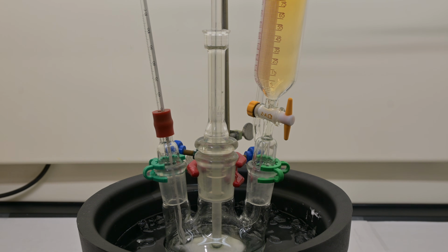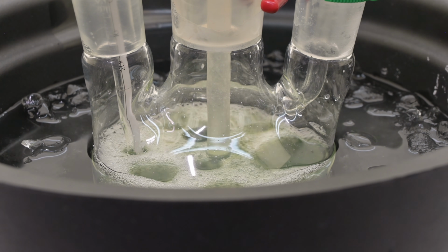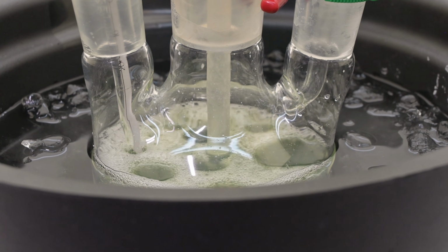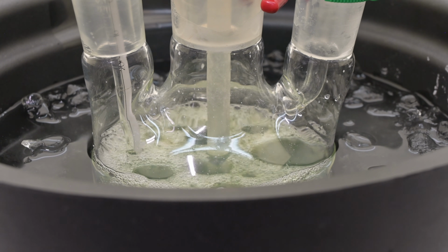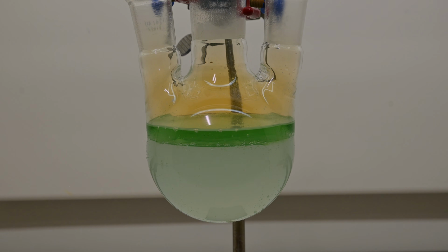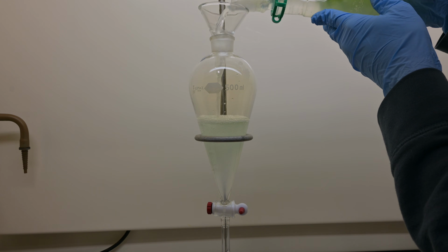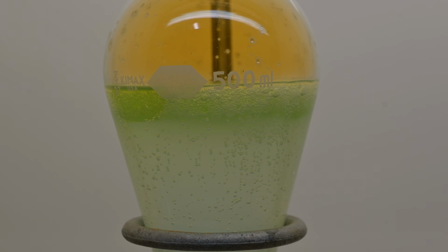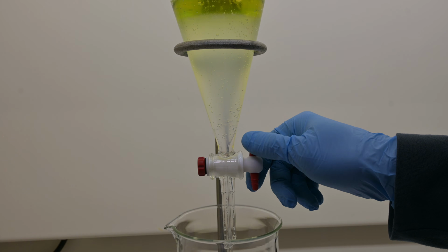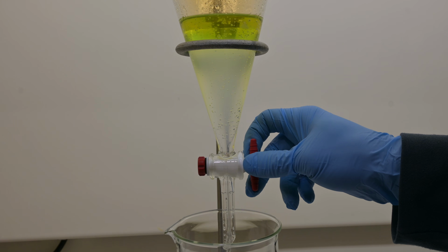Once we've finished adding the alcohol solution, we stop stirring and let the reaction mixture sit in the ice salt bath. This cooling period helps the mixture settle into two layers: an upper organic layer, hopefully containing our butyl nitrite, and a lower aqueous layer, filled with extra water, sodium sulfate byproducts, and any other water-soluble compounds. Now carefully decant the liquid to separate out any undissolved sodium sulfate, transferring the liquid to a separatory funnel. In the funnel, we now gently remove the lower aqueous layer, leaving behind the organic phase with the crude butyl nitrite solution.